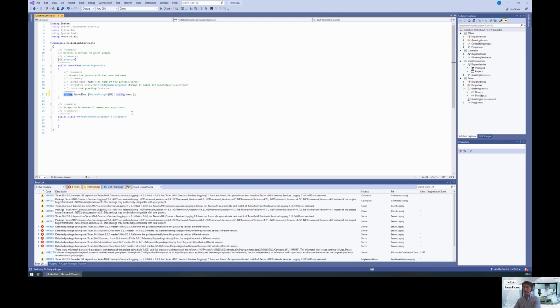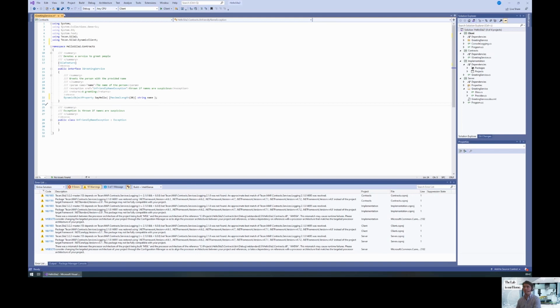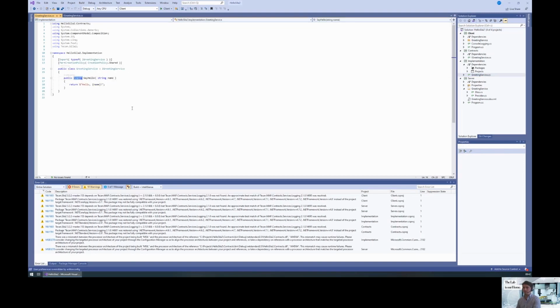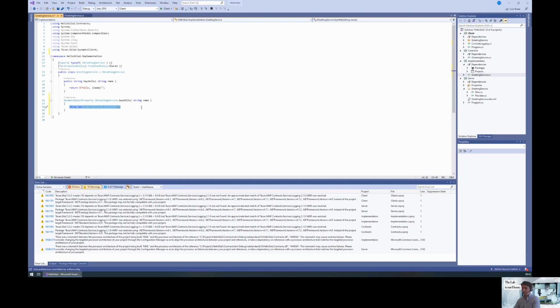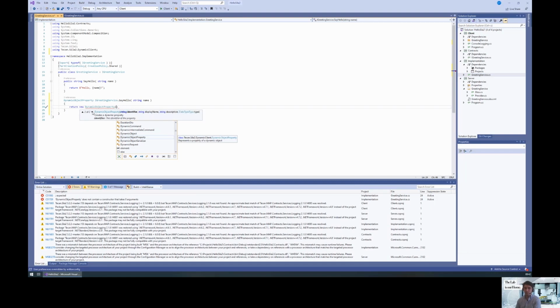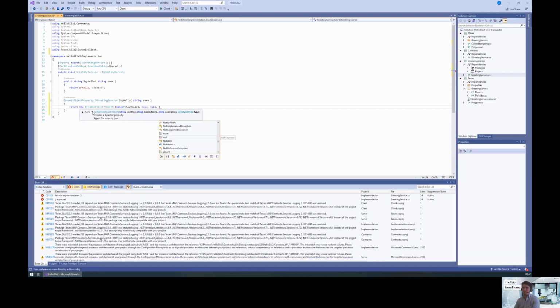Now, if we have that installed, we can say that SayHello returns a dynamic object property. We need a using statement for that to integrate that. And the next thing is, in the implementation, we have to adapt that as well, of course. So we will implement this, and what we return is a new dynamic object property. I have to put some identifier. I'll just say SayHello here and not provide a display name or description. It doesn't really matter because it's going to be ignored anyhow.